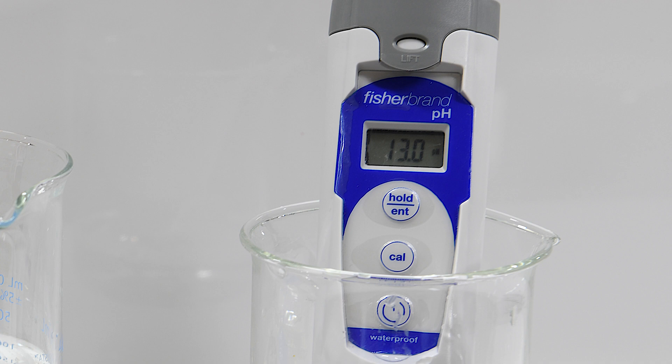This wraps up all of the pH measurements for our experiment. So go ahead and use the data that you've collected to answer the questions at the end of the lab.